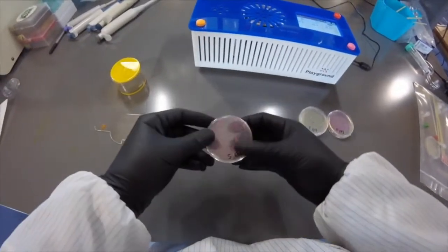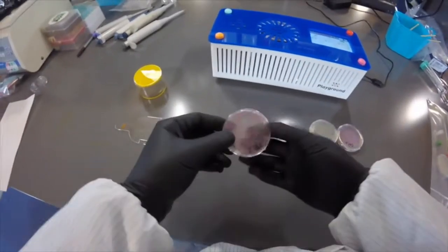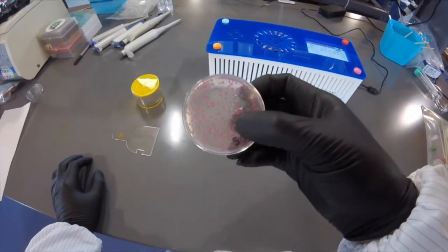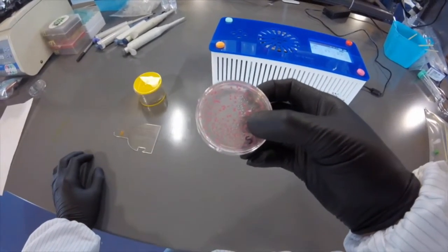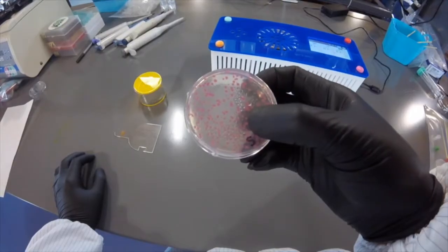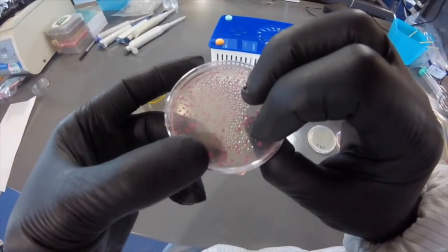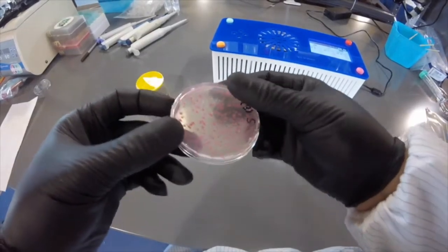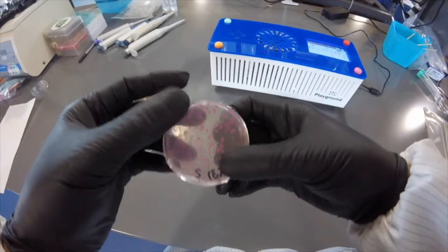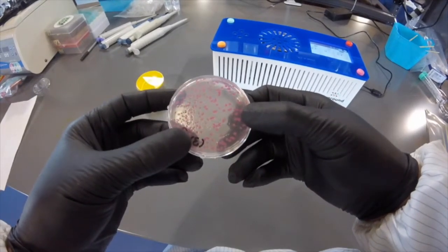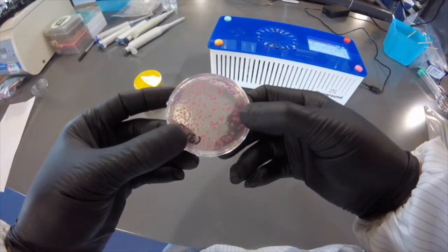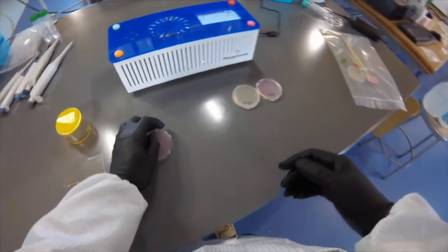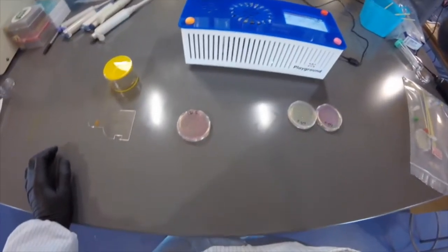Now here's the main show. This is the experimental sample and the colonies you can see are quite beautiful. We had a lot of nice raspberry red colonies, and I don't really see any white colonies—no, it looks like they're all nice and pink. Actually, I'm going to grab a black light. It's a little bright in here, so we won't really be able to see it well, but let's see if we can see any fluorescence.